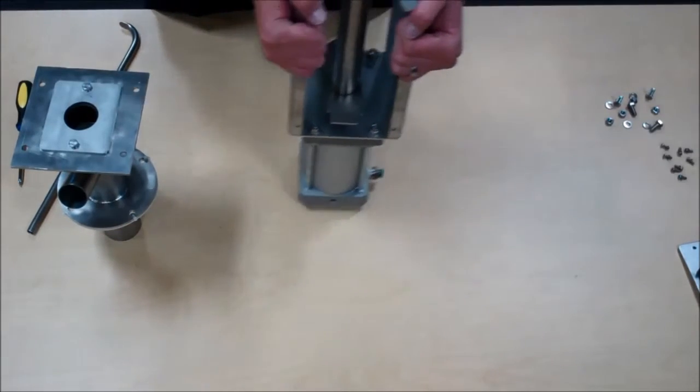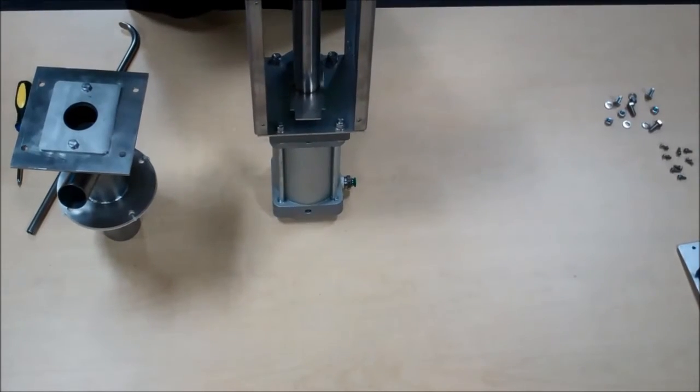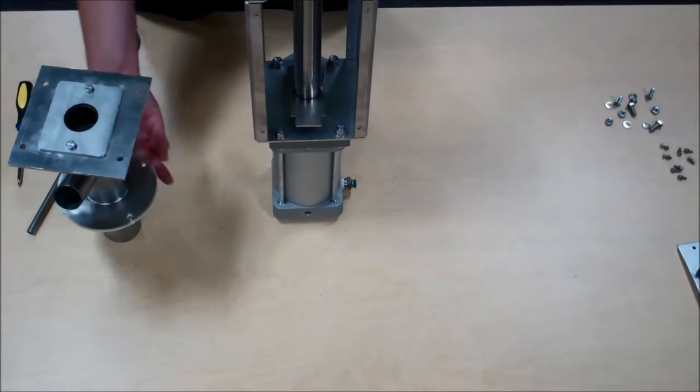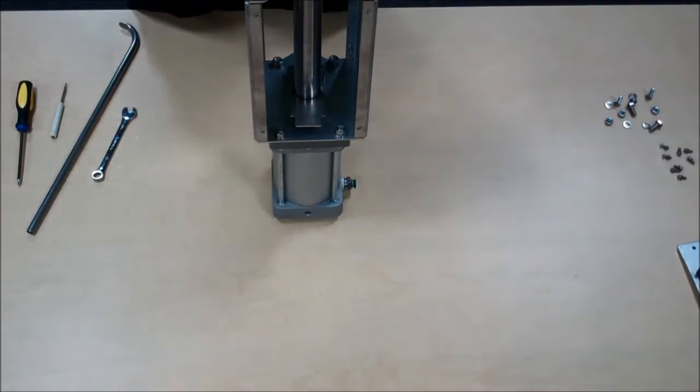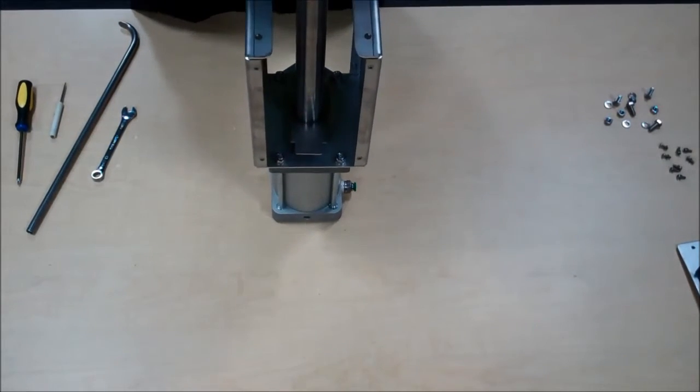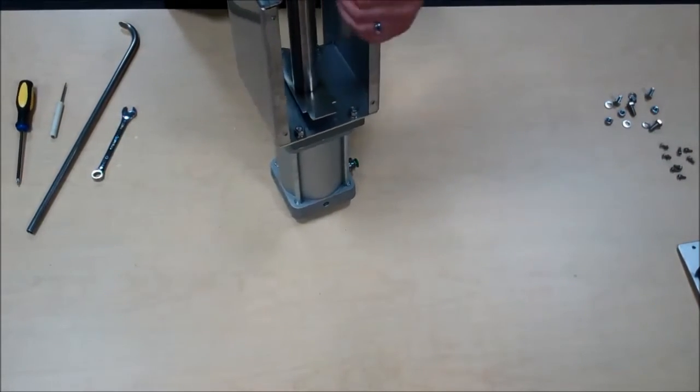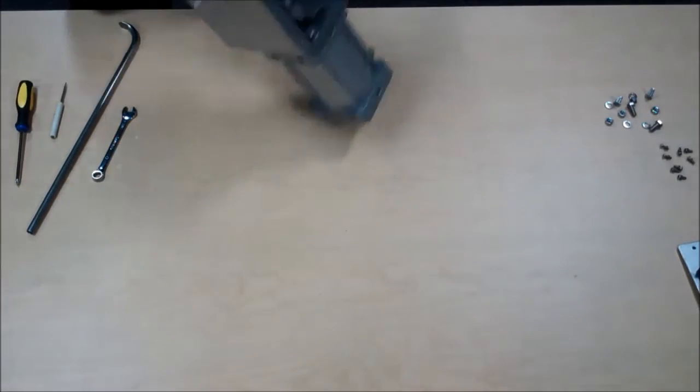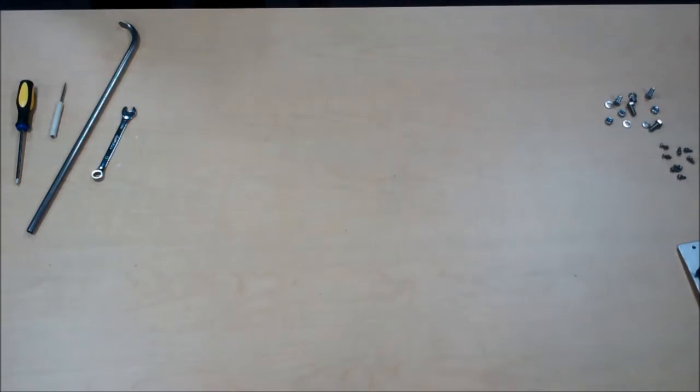Take note of the discharge hole in the sample tube, it is to line up with the discharge hole of the housing. This also may need to be pushed together down on the floor.